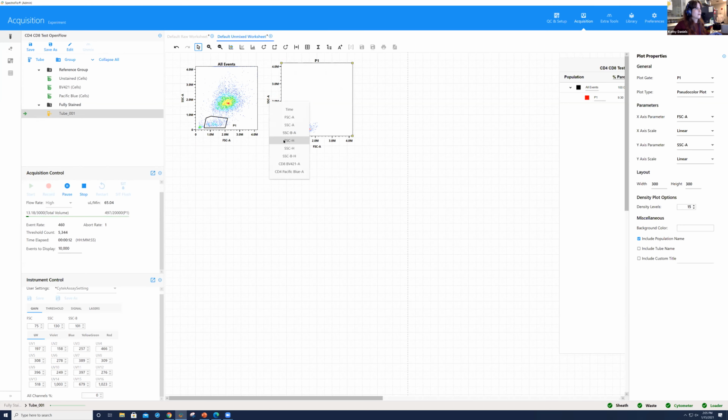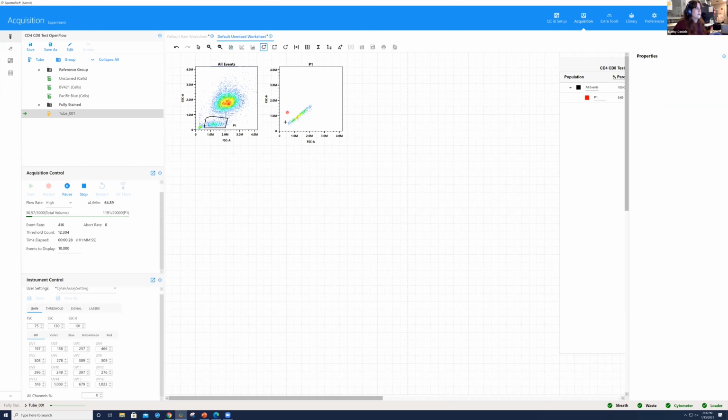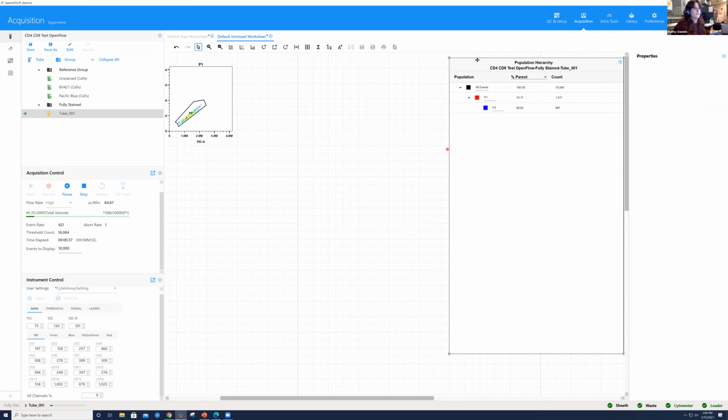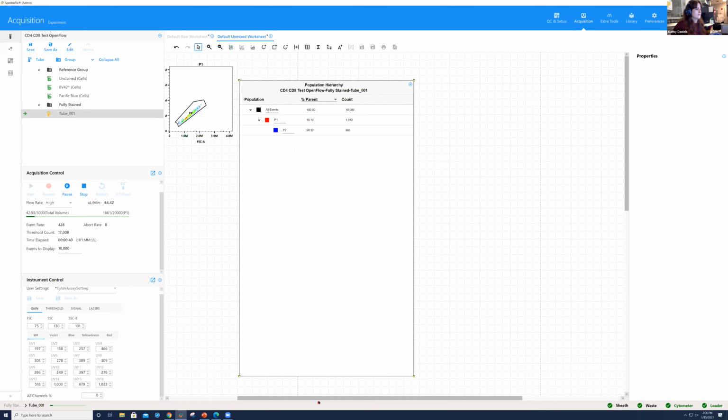So if I right click, I can choose forward scatter height. And you see now, I'm no longer seeing UV 1, 2, 3, 4, 5, 6, so on and so forth. I'm seeing the parameters now that it's unmixed, which is what we're more traditionally used to seeing. I'm going to select a polygon and set a singlet gate and double click to close. Create a population hierarchy here, which already exists, so never mind.